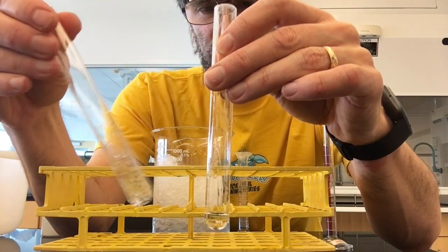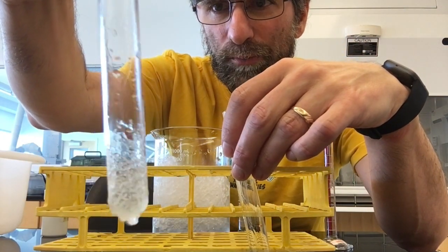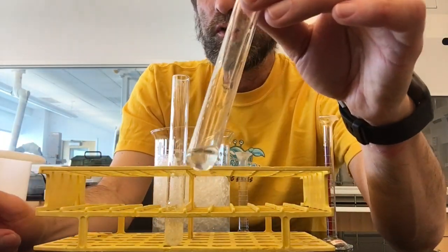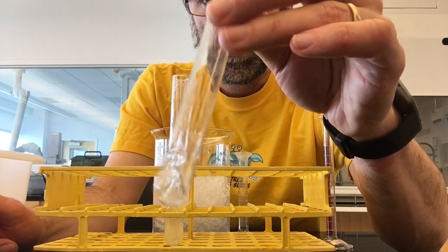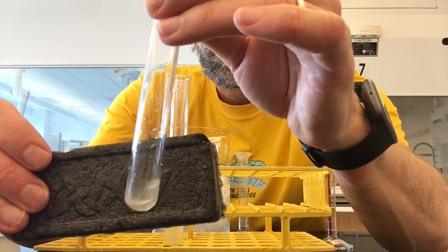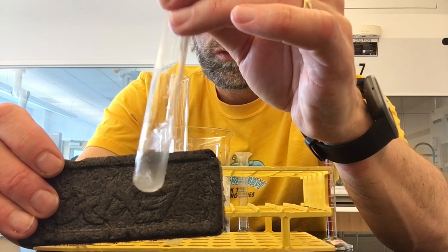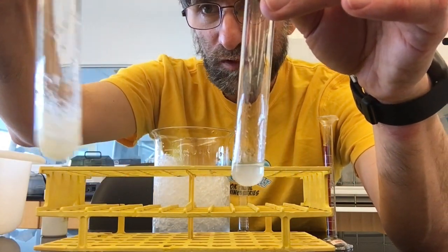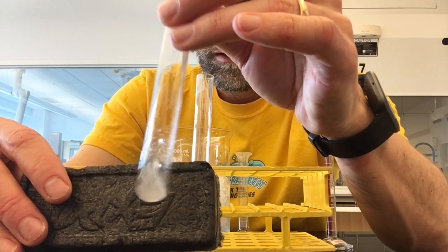They've both been chilled, and you can see that the iodoethane is starting to react. The primary iodo compound is definitely reacting completely. We'll just watch the bromoethane for a while — it still hasn't reacted. Hopefully as it warms up it will start reacting, and it's starting to get cloudy. With a dark background you can see it's a little bit cloudy. Eventually it will be as reacted as the iodo compound, which has really formed a lot of solid. The bromoethane is still reacting slowly, but it's getting there as it warms up.